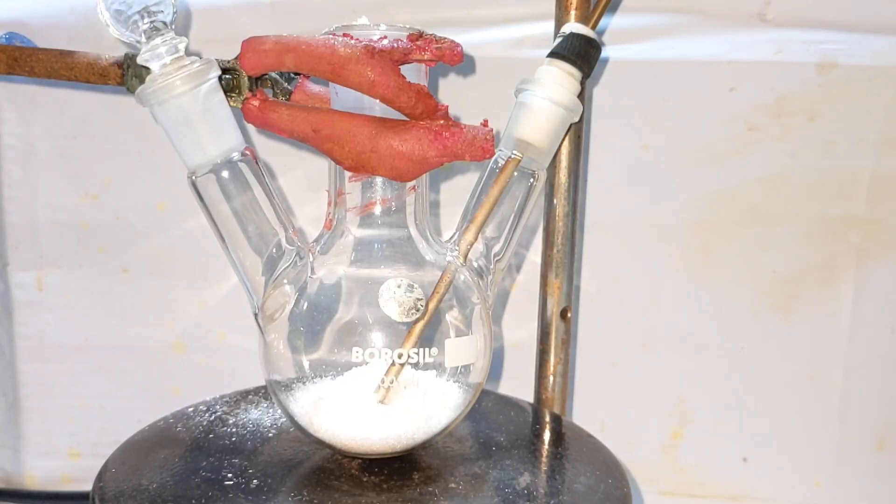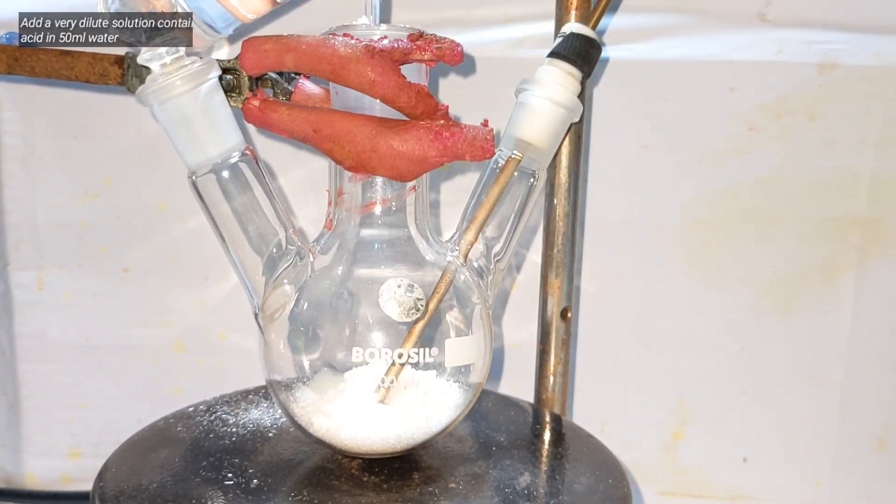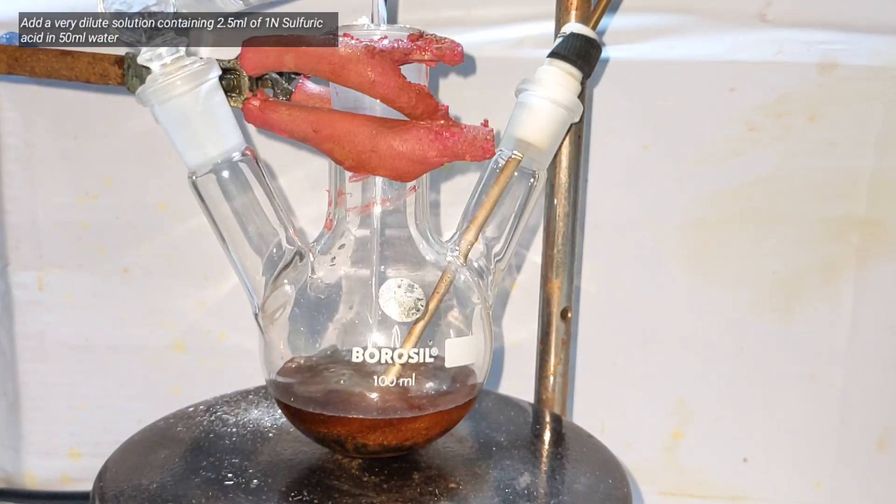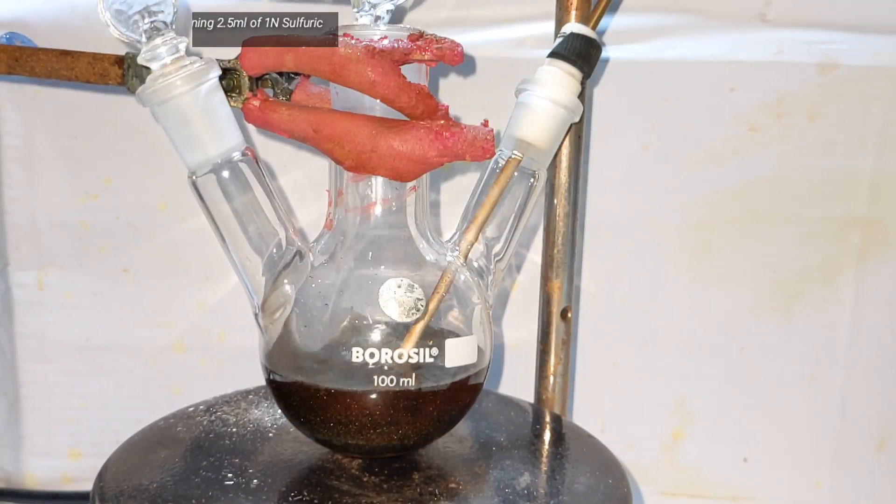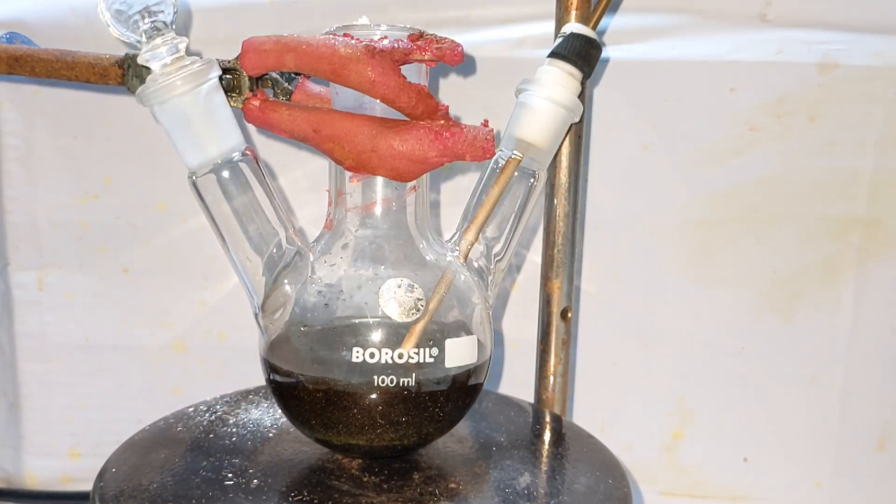Now we need a very dilute solution of acid. What I added was 50 milliliters of water which contains 2.5 milliliters of one normal sulfuric acid.